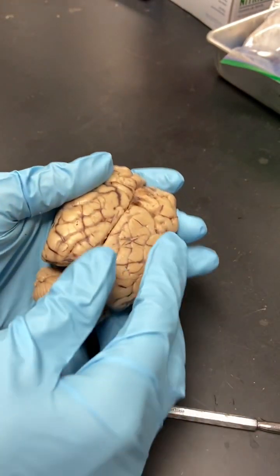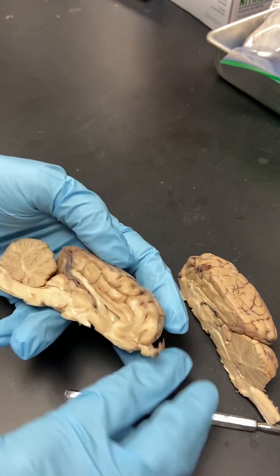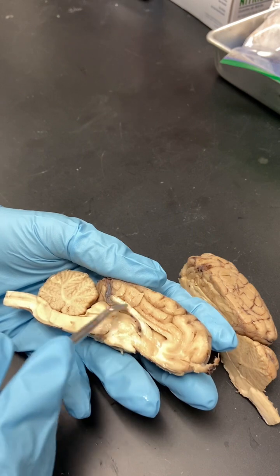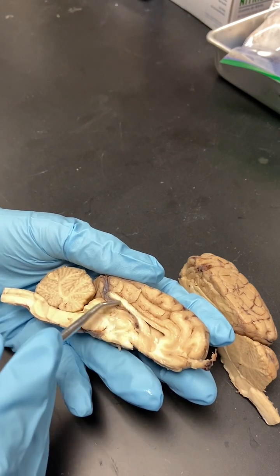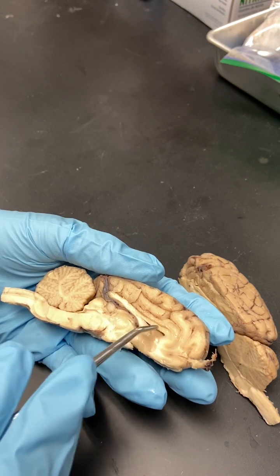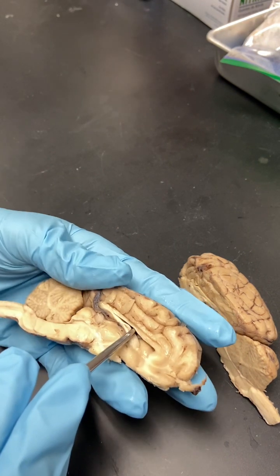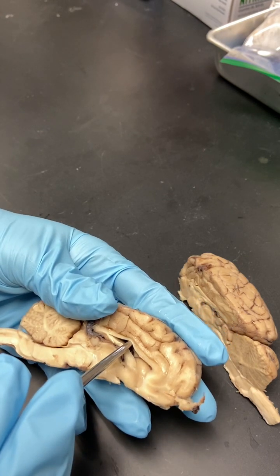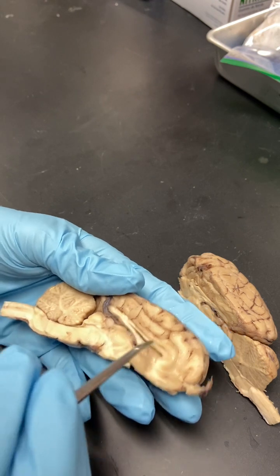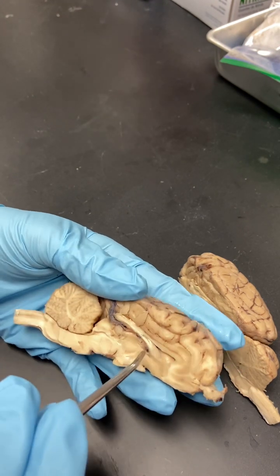So if we look at it from the side, this is a really great cut here made by Emily. We have this very white line here. This is the corpus callosum. This is what connects the left and right hemisphere. And then just below that is this hole. It is a little squished right now, but not normally. Normally it's open like this. This is the lateral ventricle, and it's full of fluids. So just inferior to that, you're going to find your thalamus.